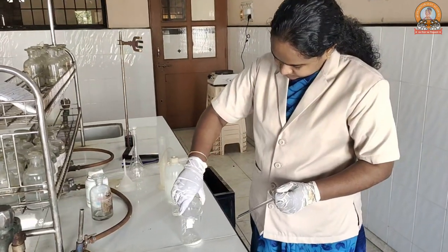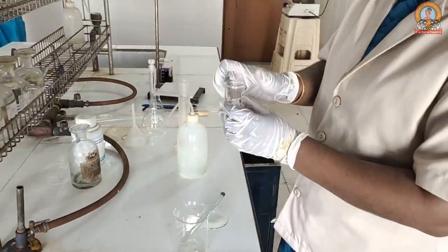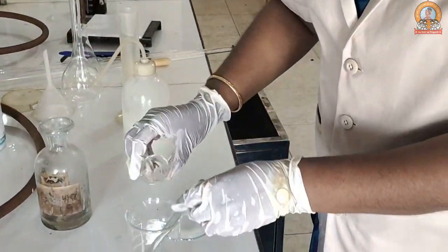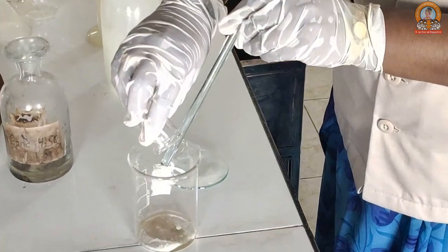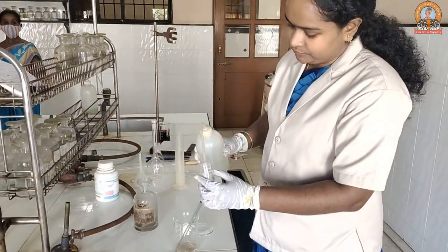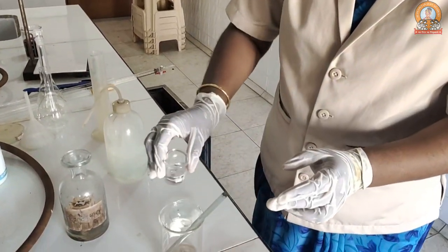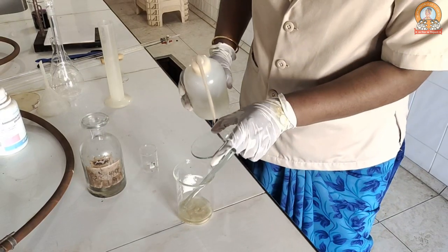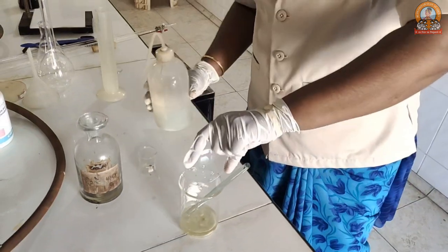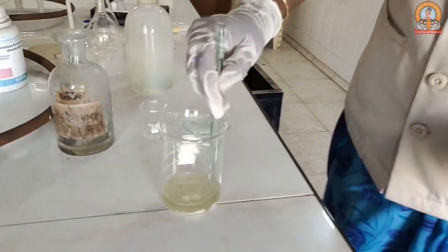We add the salt into a beaker and we will add 5 mL of concentrated sulfuric acid into it. This is just to prevent the hydrolysis. Then we start adding water. You can wash the beaker carrying acid with water so the remaining acid is added to the salt, and then wash the Petri dish with water and start dissolving it. Because there is an acid, it dissolves very easily.